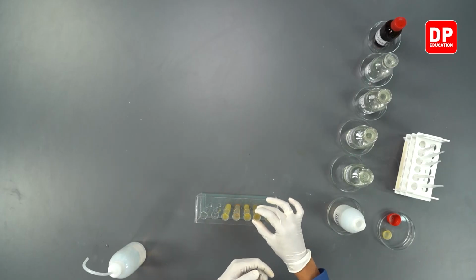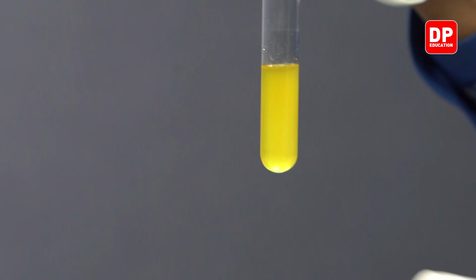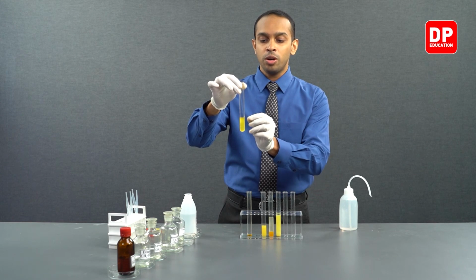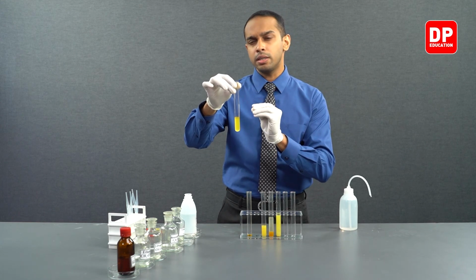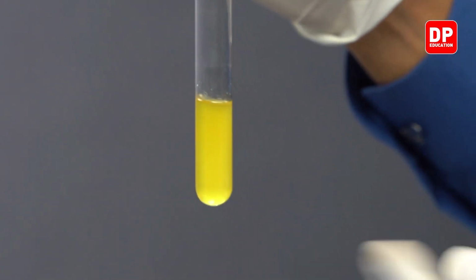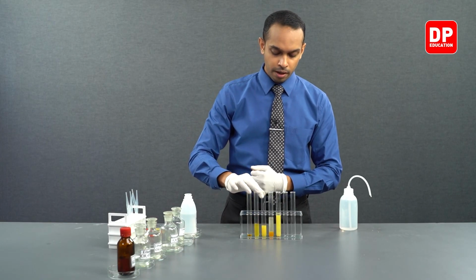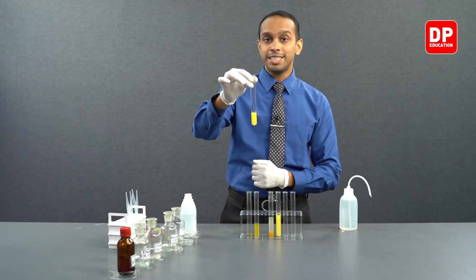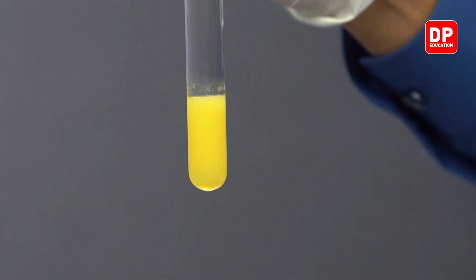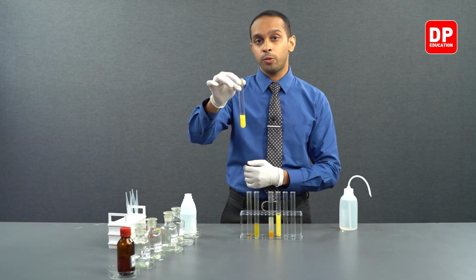As you can see, when we reacted acetaldehyde, a yellow-orange precipitate was formed. You can see by the cloudy nature of this solution over here that this is due to formation of tiny, fine particles of precipitate that turns the entire aqueous medium into a yellow-orange suspension. And then we reacted acetone with 2,4-DNP. You can see again a cloudy precipitate is formed here due to the reaction of acetone with 2,4-DNP.